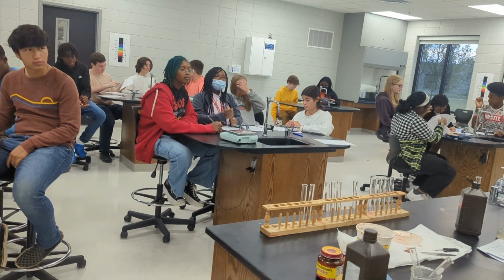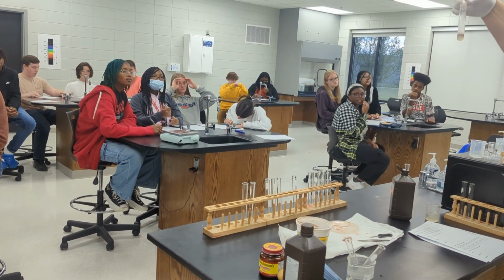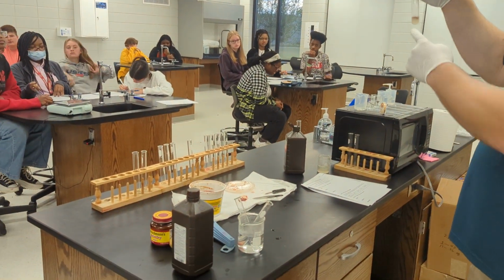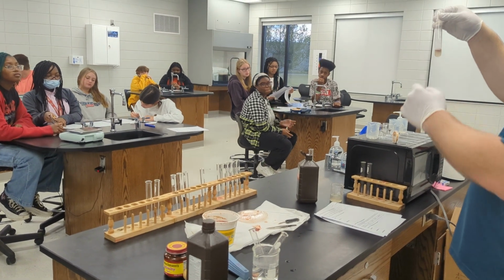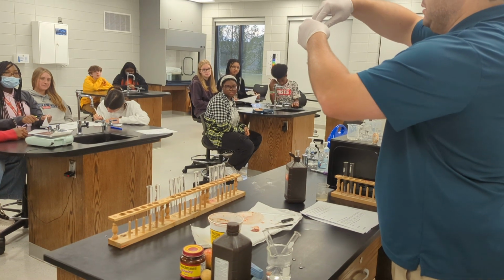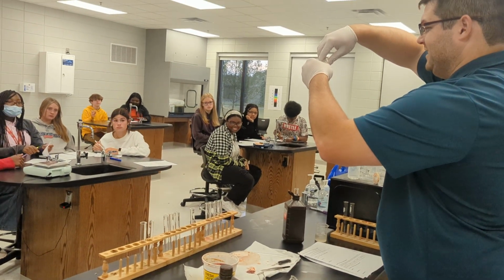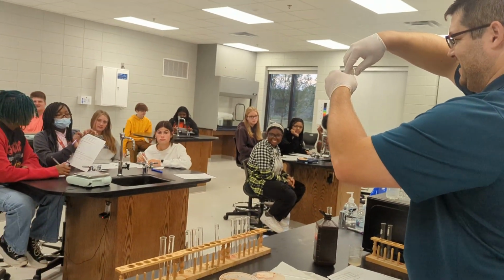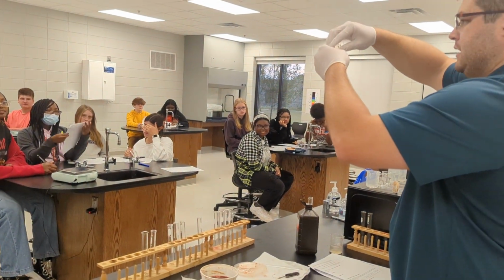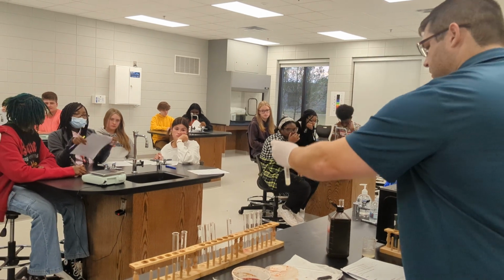So now what we're going to test is, we have let this reaction work for a good bit. I don't think there's many more bubbles that are going to be produced. I'm actually going to take this liquid that the liver was sitting in. Now I'm going to pour it into my test tube. No, I'm not drinking. Test tube number 2. Yeah, so this is test tube number 2. I poured the runoff from here into here. Try to get it all as much as I can. All right.